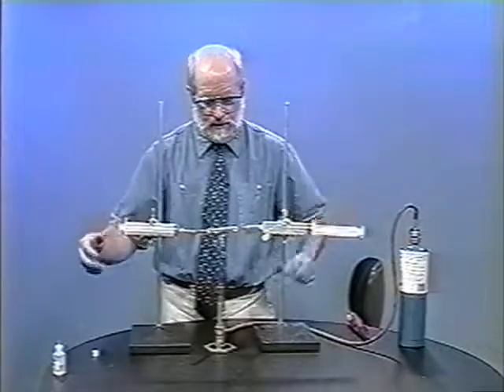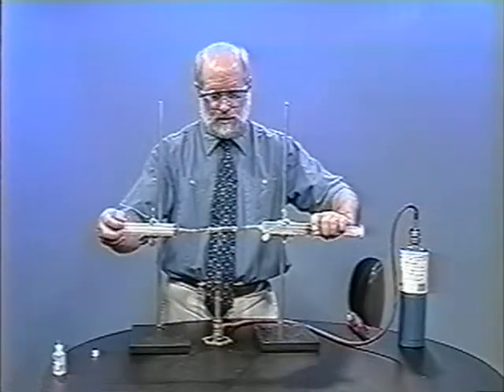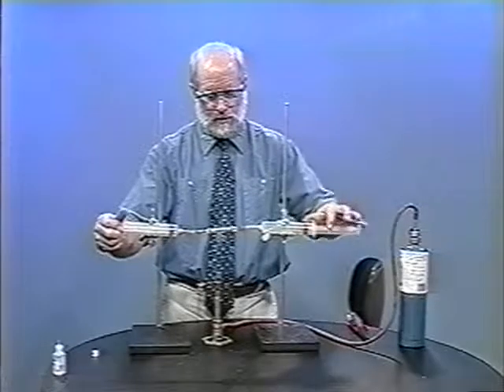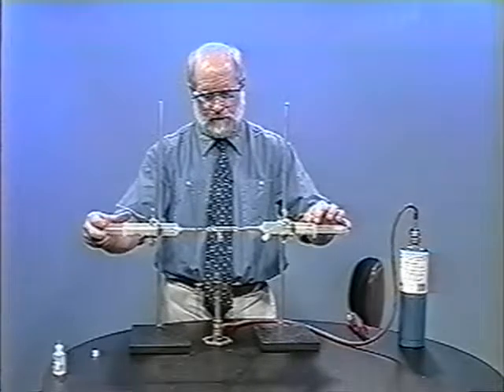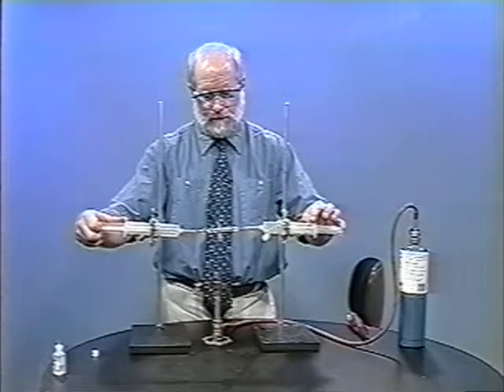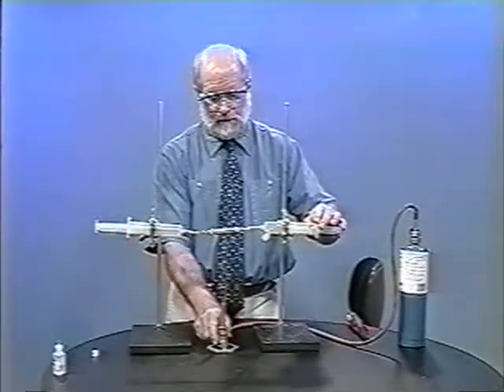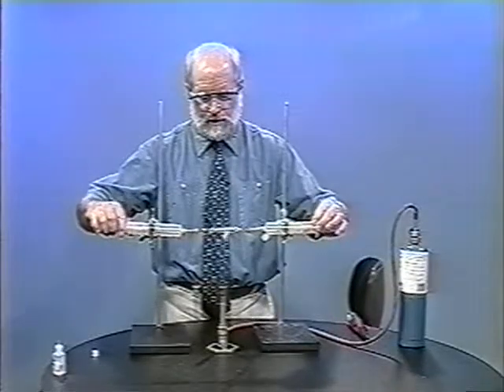And now let's pass the gas through. I'll even remove the flame for this, see if that works — sometimes it does, sometimes it doesn't. And on the right, we can see the products are cloudy. So that's water vapor that's condensed from the oxidation.